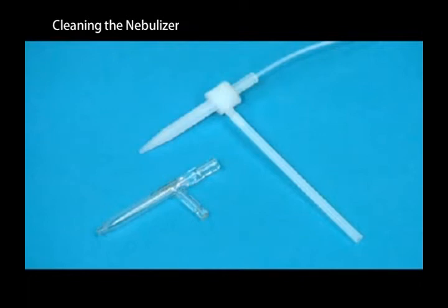Remove the nebulizer and check for damage. Replace the nebulizer if necessary.